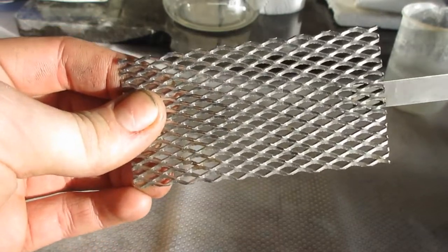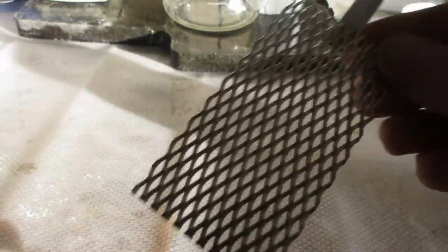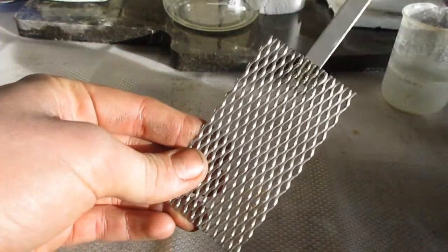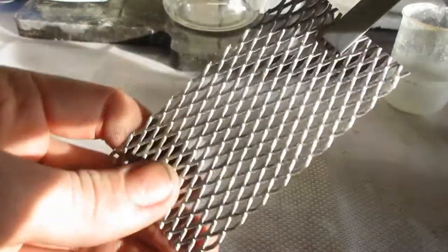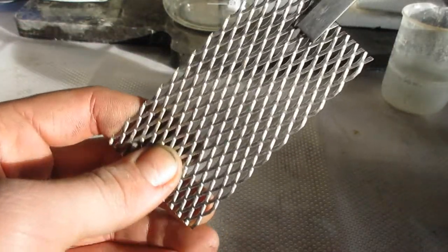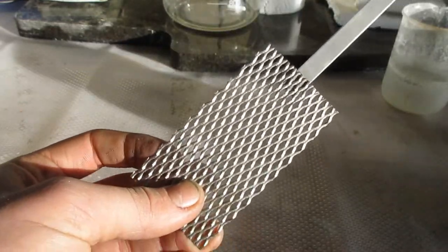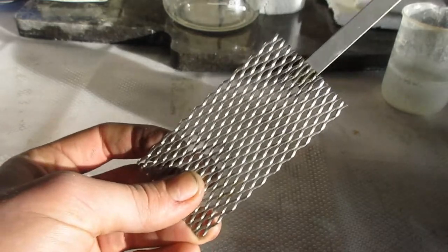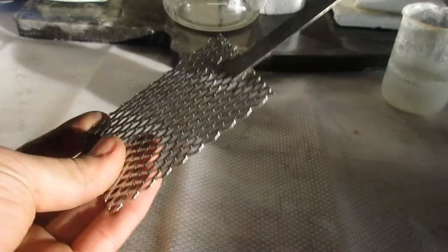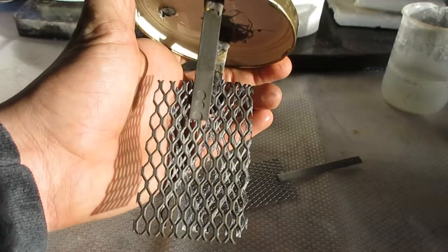But in doing so, I realized an important distinction that I don't think anyone really before has addressed that allows you to fairly easily distinguish these fake anodes that are all over the internet, that these Chinese companies try and list, and genuine ones. So let me show you.